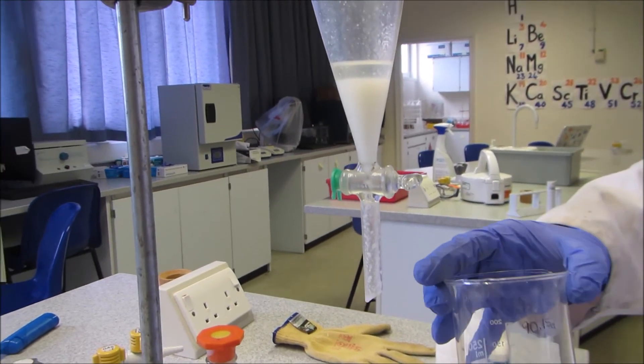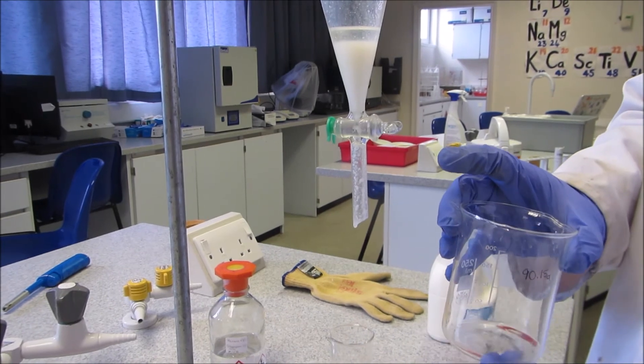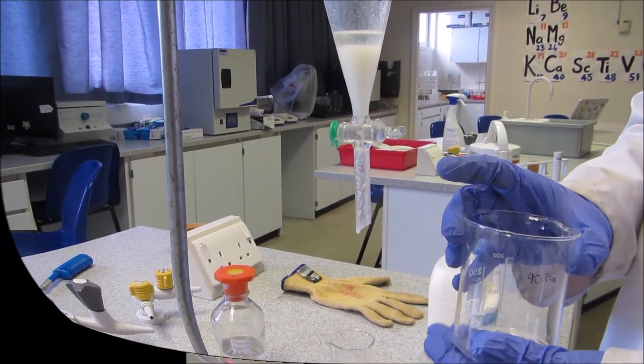Once I've got the second layer, I'm then going to put this on to evaporate the solvent, and we'll be left with the residue fat at the bottom.